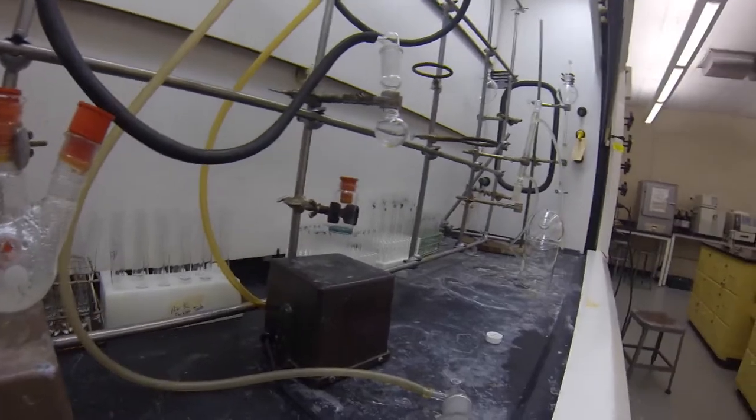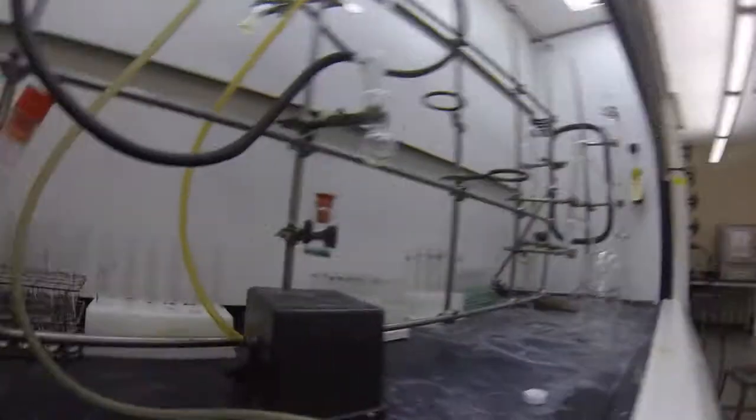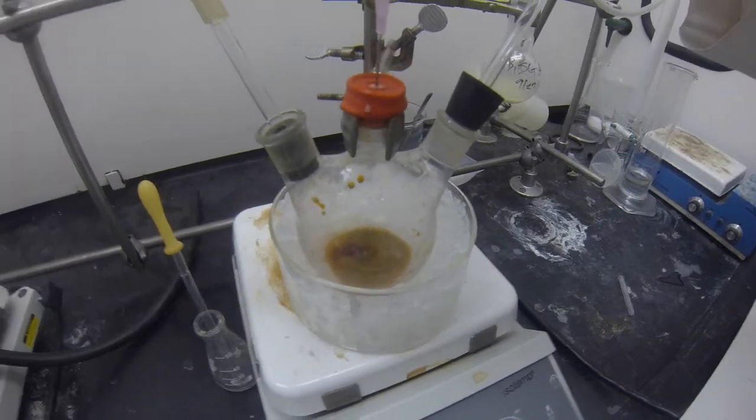Lee, what is this sweet reaction? So it's oxygenated there. It's going to be up to the sodium catalyst, and so we just made something awful. It looks great. It looks gross.